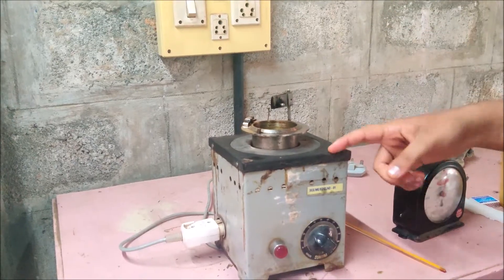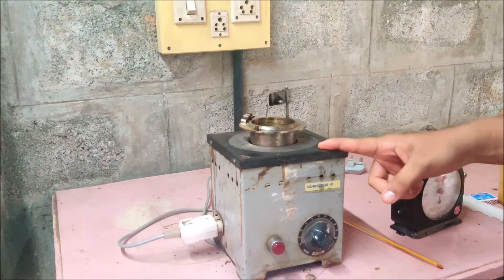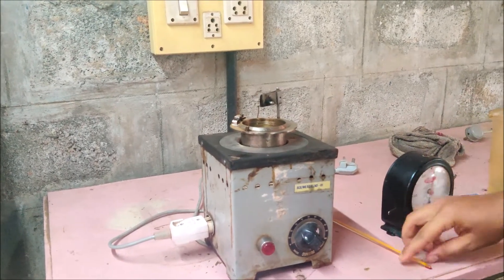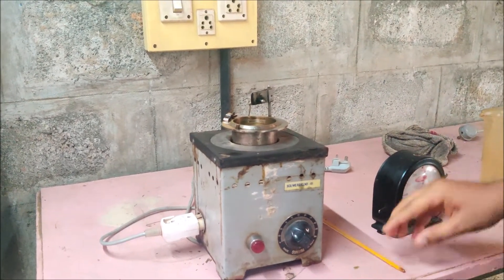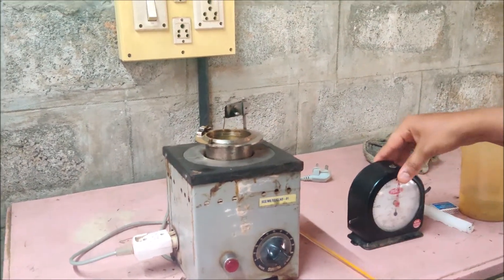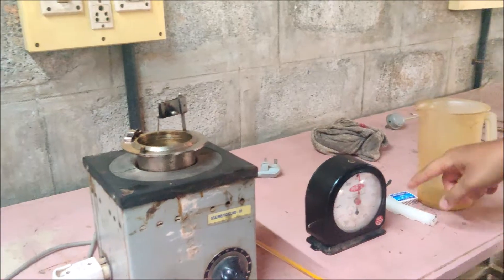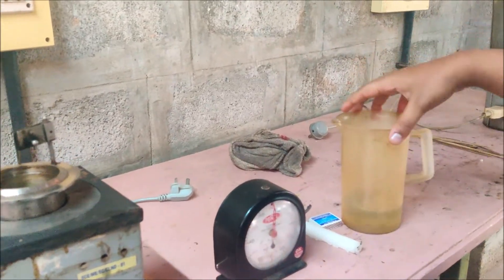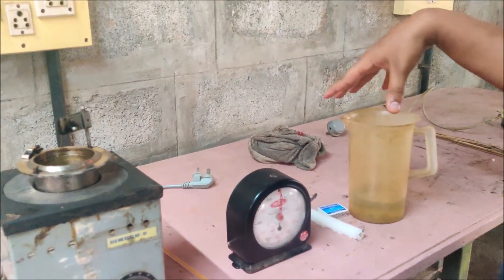So this is the apparatus, and this is the thermometer, and this is the stop clock, and this is the fire source. And this is the given oil sample, which is diesel.